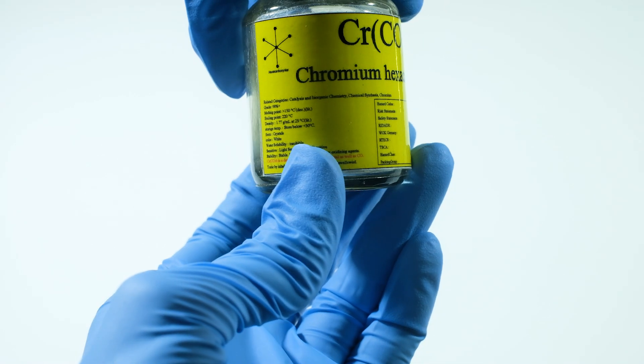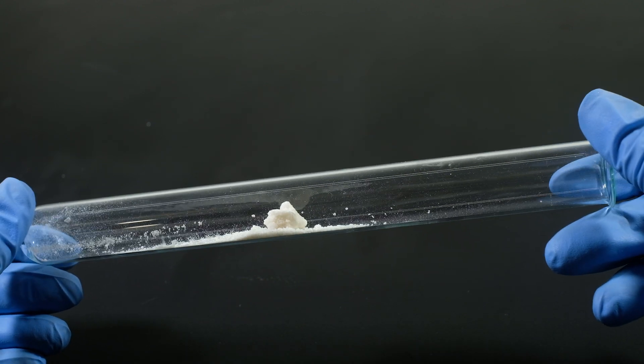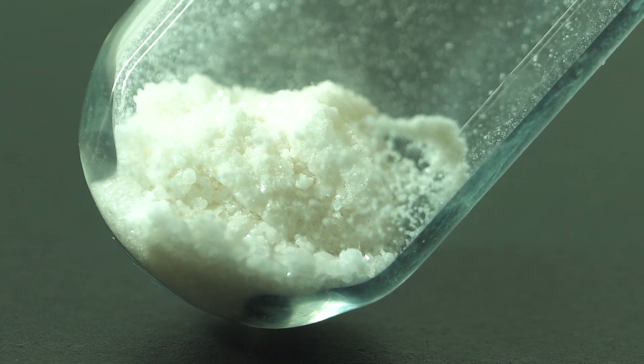In the previous video I told you about chromium hexacarbonyl. These white crystals don't like various chemical interactions that much, but nevertheless I will show you another interesting reaction I told you about earlier.